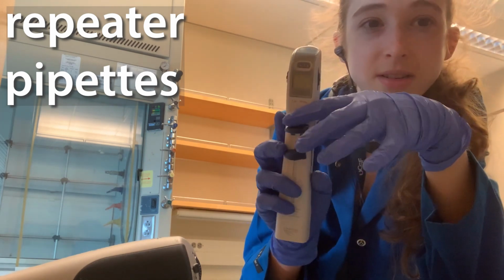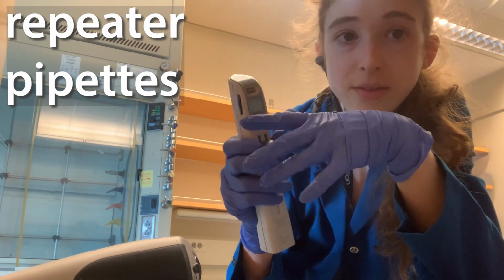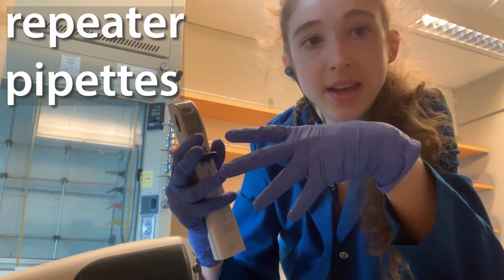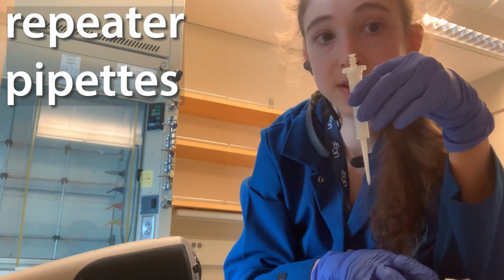And based on the size, the gradations that you can do are going to be different. It'll have different set levels. Some of them might be 1 microliter, but some others will be increments of 10, others will be increments of 50, that sort of thing, depending on the size of one of these.